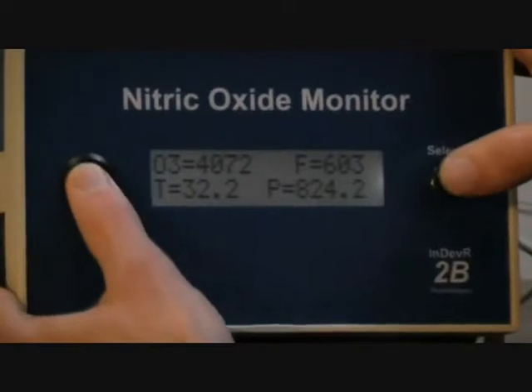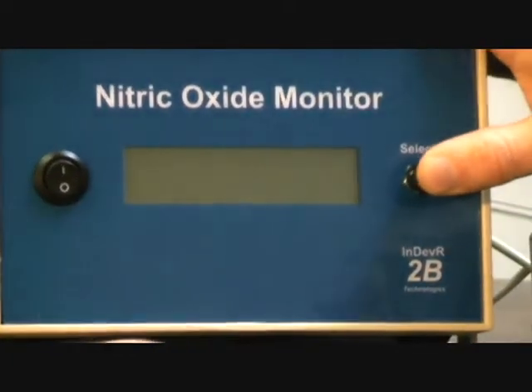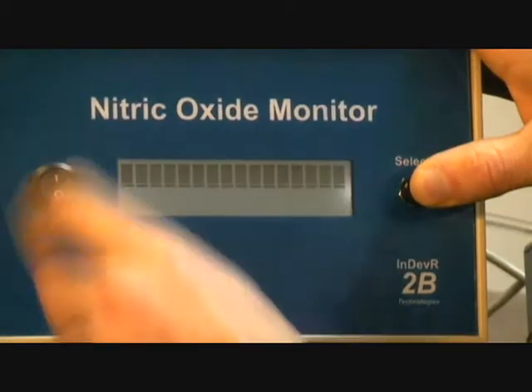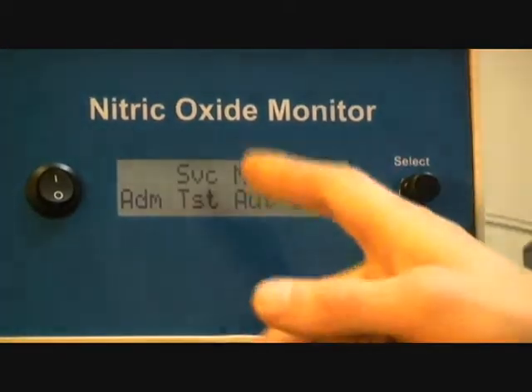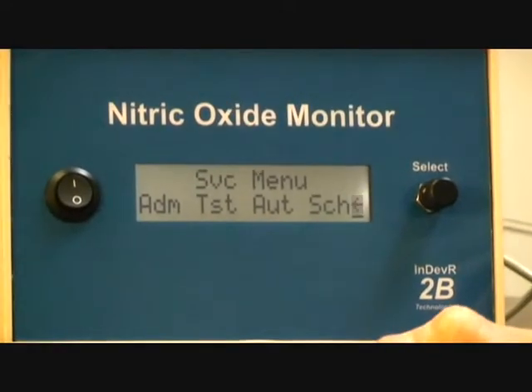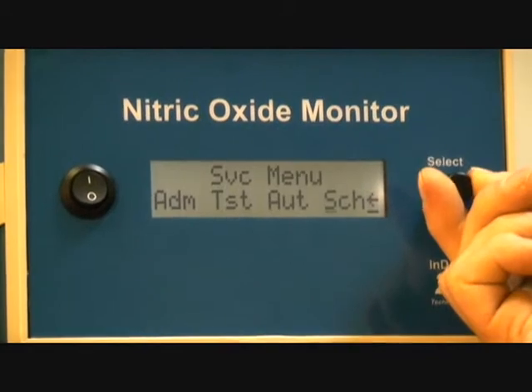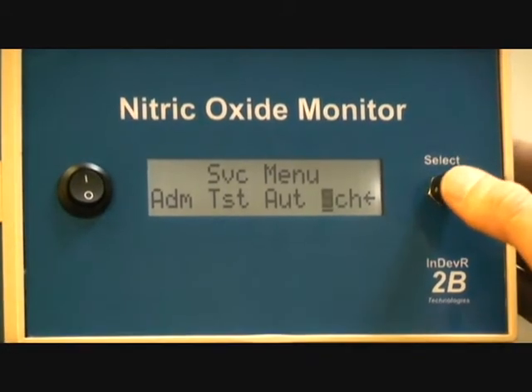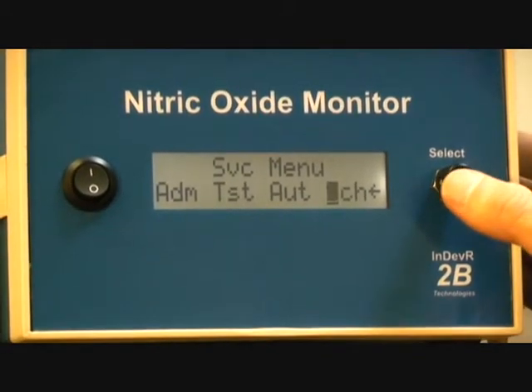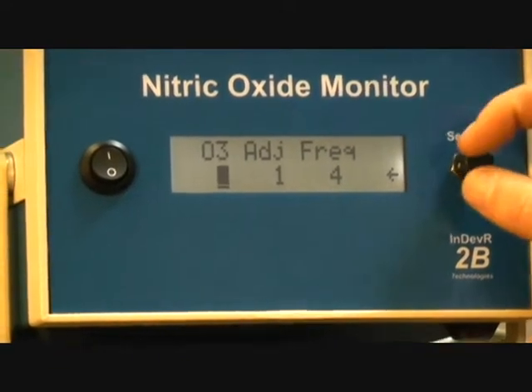The way to access the menu for setting up the parameter adjustment mode automation is when you're turning it on, you want to hold down the button. Then you can see it enters service menu. This isn't a very typical menu option, so we put it under service menu. If you select SCH, which is short for schedule, we'll see O3 adjust frequency.